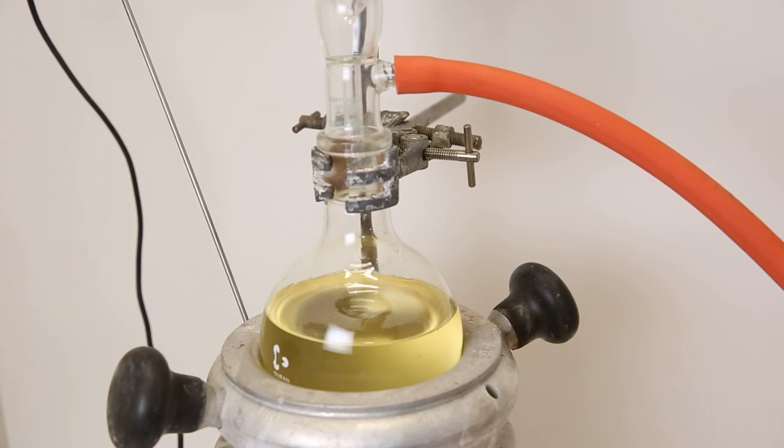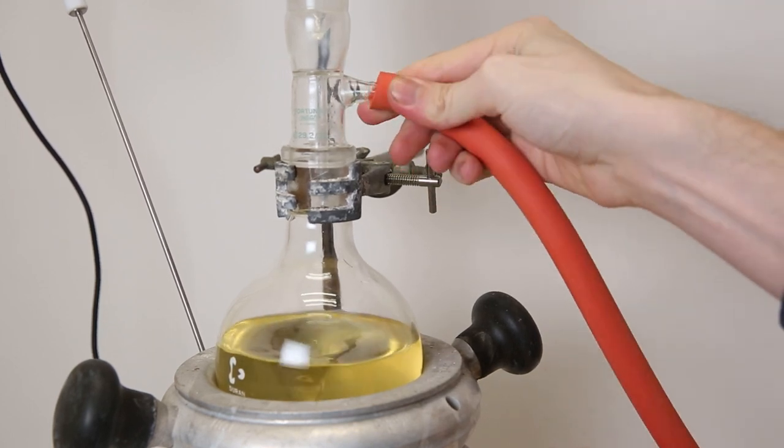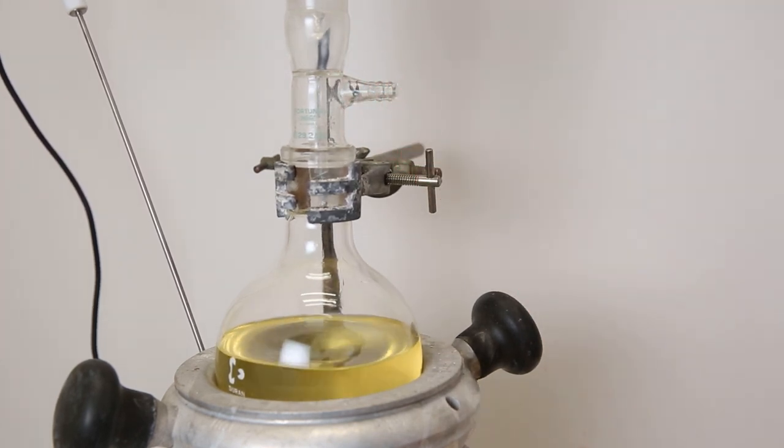Anyhow, I just leave it to boil in a vacuum overnight. The next day, I come back, and there is nothing boiling, even at high temperatures and being under vacuum, so most of the toluene should be gone by now.